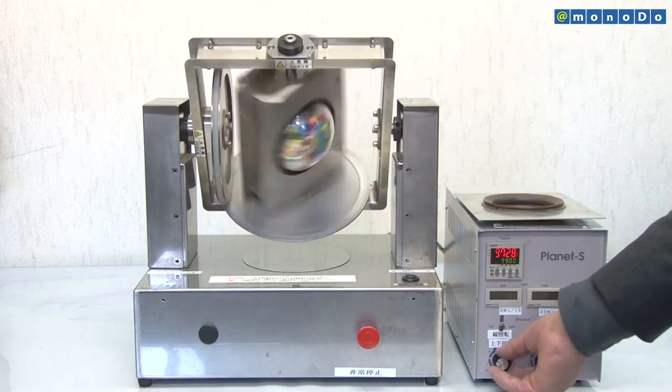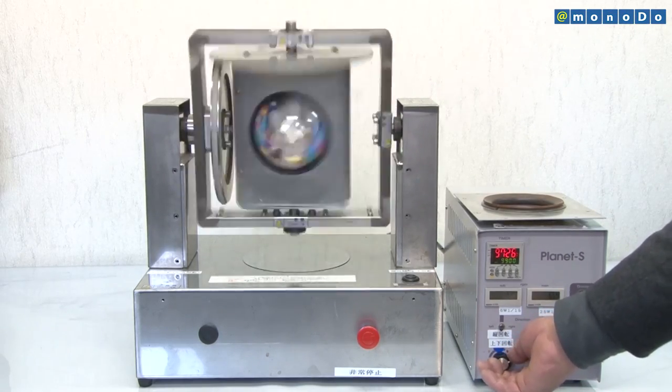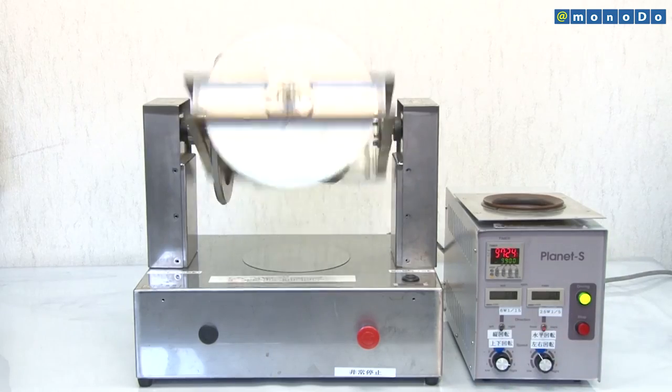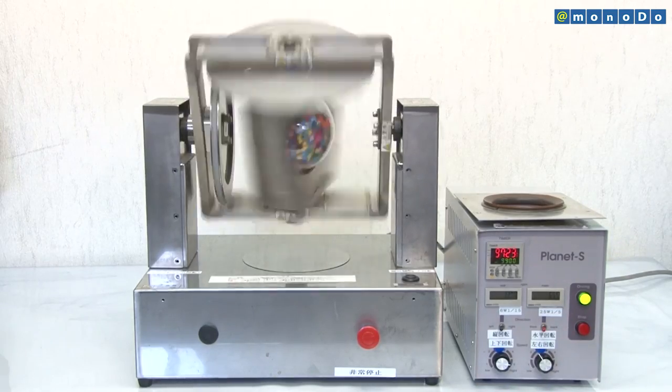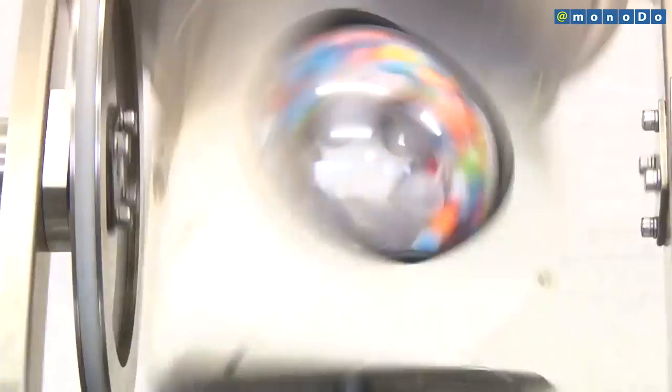Nagao Systems has designed a ball mill in which the container, located at the intersection of the X and Y axes, is rotated in three dimensions using these two axes. This action enables the contents to be pulverized at over twice the efficiency compared to conventional machines.